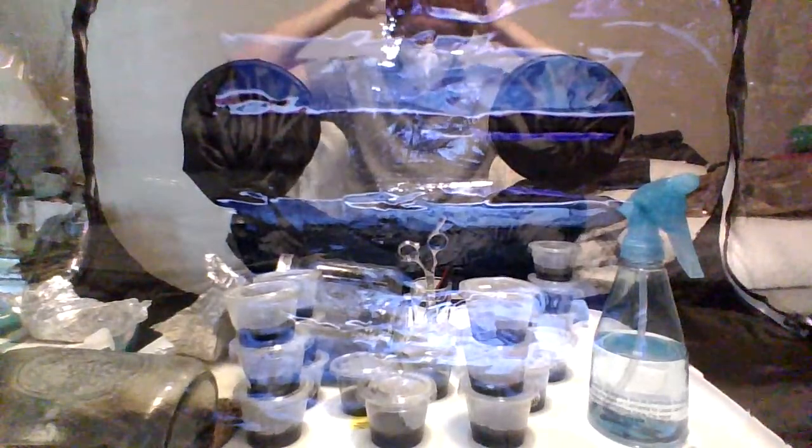All right, this video is not going to run that long, so don't worry, I'm not going to bore your heads off. First, I'm going to put my mask on, like my KN95 mask, because it's very effective. It's more effective than a surgical mask, guys. Like I said, it's not super DIY tech, but what would be is just to put on a bandana, wrap a clean shirt around your face, whatever. It could be whatever.